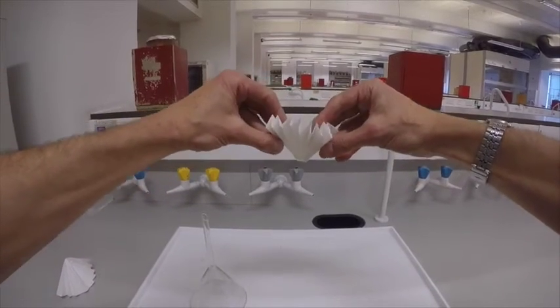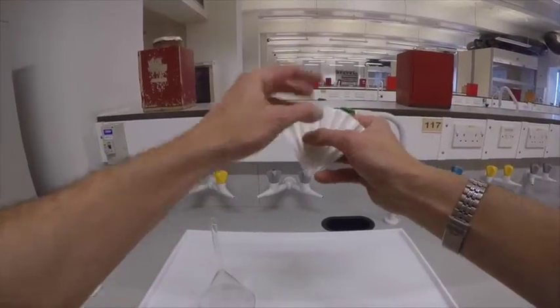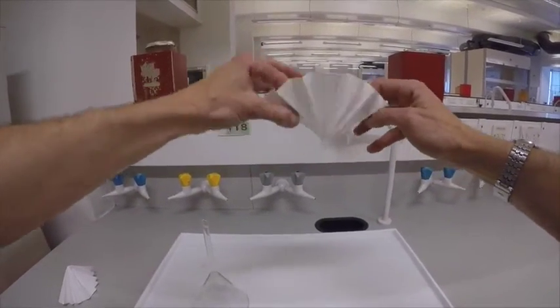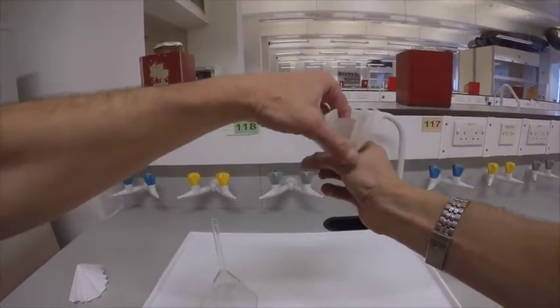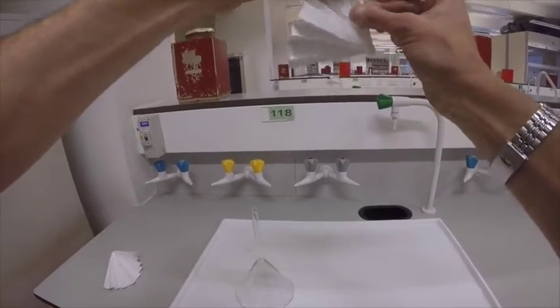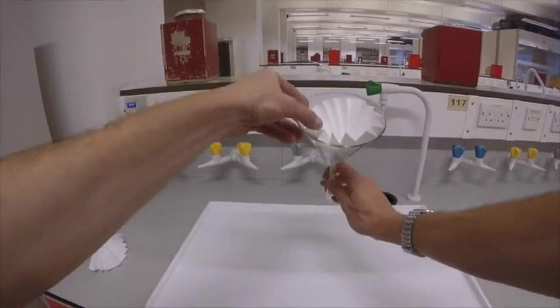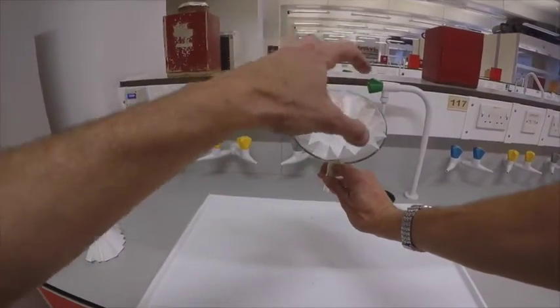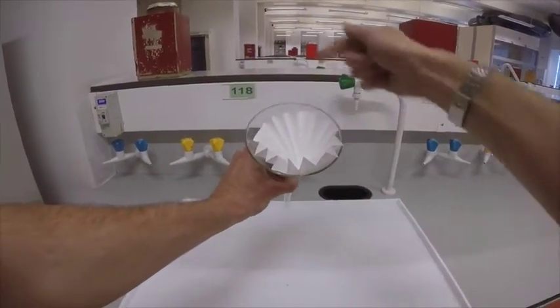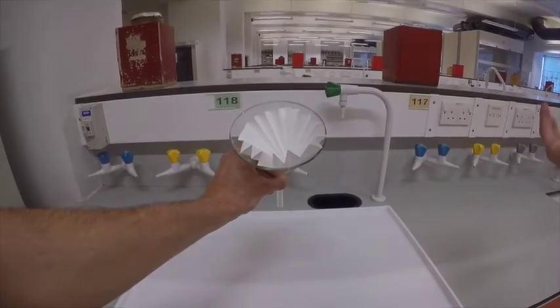When you pull it out, notice how it is down, up, down, up — alternating — and that means you can open it up. In fact, in a strange sort of way, it reminds you of those Elizabethan ruffs that men used to wear, possibly not in the lab. We can now place it in our funnel, and you'll notice that the filter paper sits proud away from the glass itself, and the entirety of the area is actually exposed to the liquid. Simples.